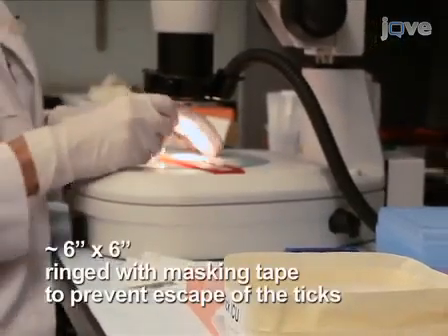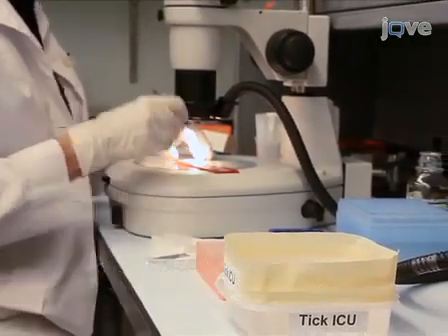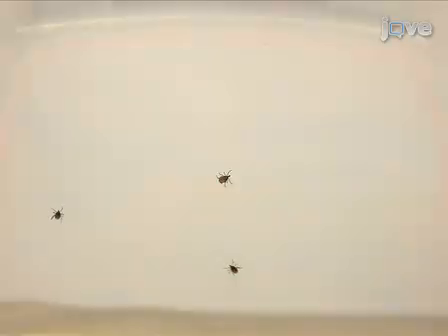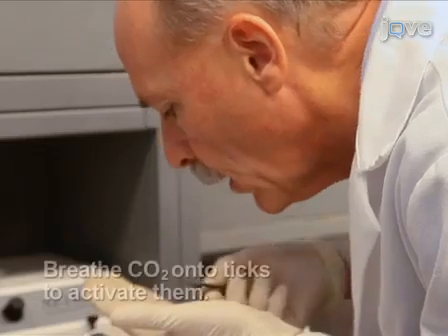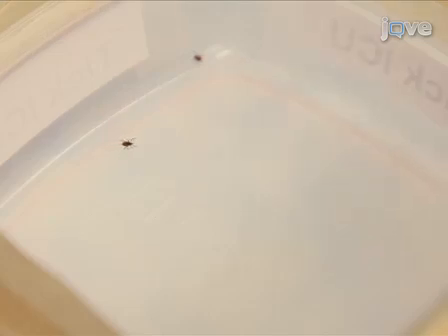Immediately after injecting the ticks, pick them up from the double sticky tape with the fine forceps and place them in a plastic recovery container. The ticks will briefly remain inactive after injection, but should soon begin to crawl around the dish. Activate the ticks by breathing carbon dioxide onto them. Once the ticks are crawling and active, the injection wound will heal rapidly and they will most likely survive.